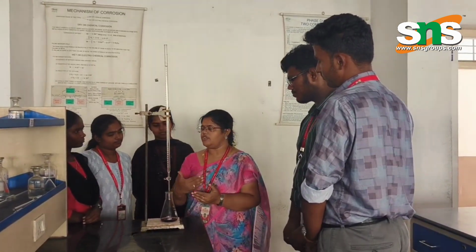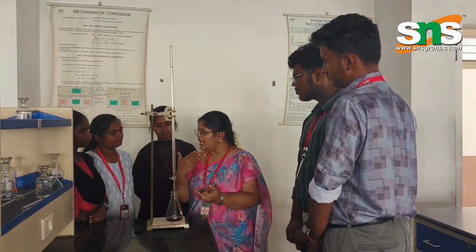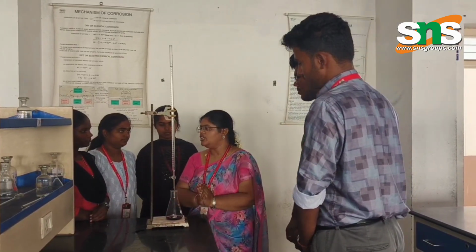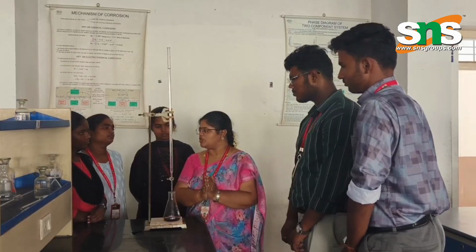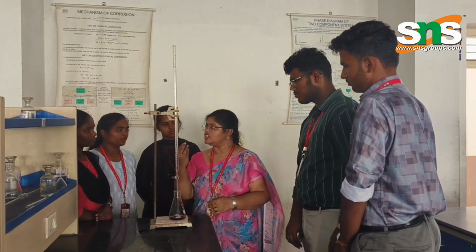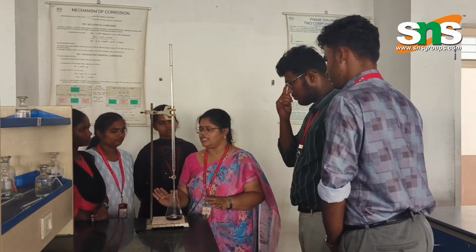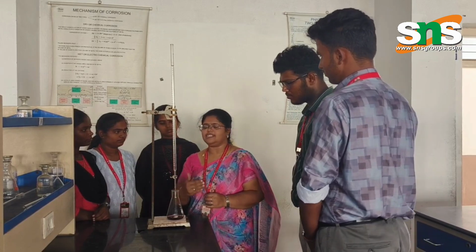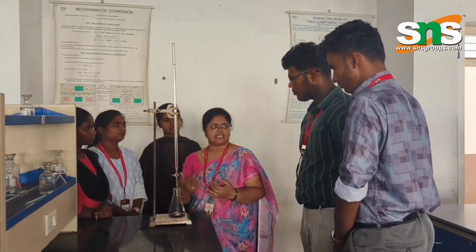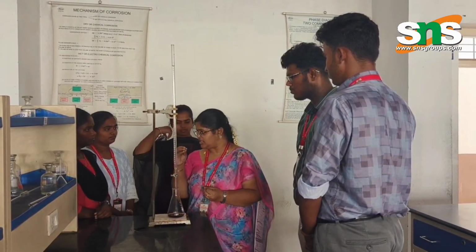We are going to use the water for domestic purposes, industrial purposes, and agriculture purposes, and we have some standards which it should meet. How much chloride is present, how much calcium and magnesium, and the total dissolved solids, TDS. All these things we are going to estimate and assess whether the water is good for domestic purposes, industrial purposes, or agriculture. Even for agriculture purposes, we have to check the water, right?